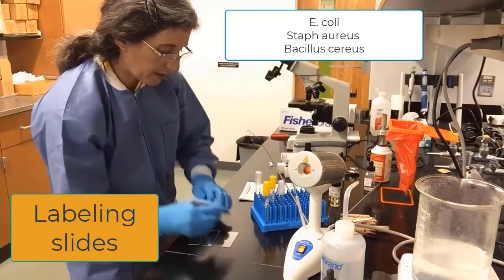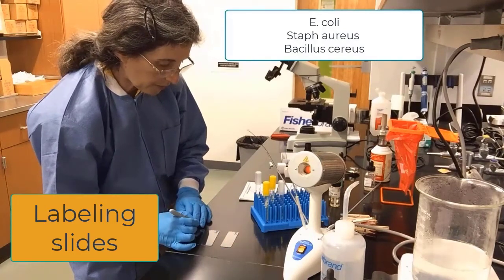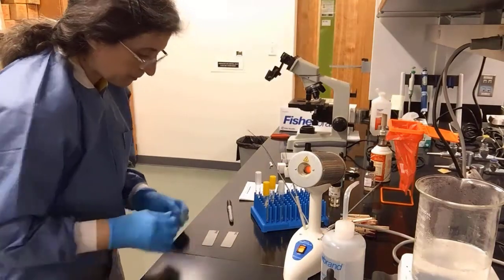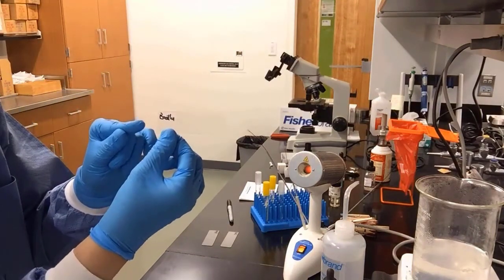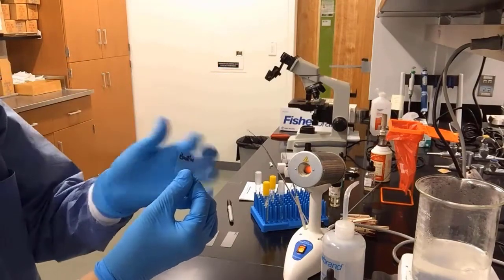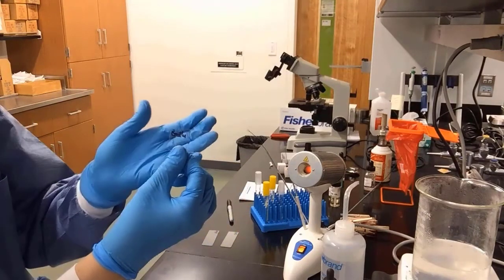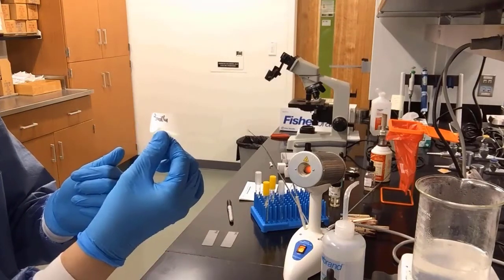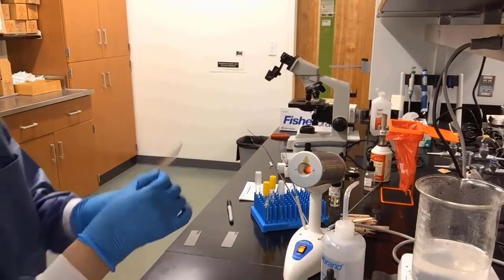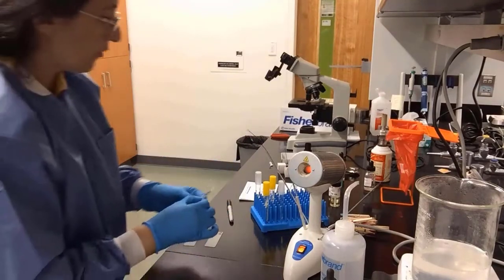Labeling our slides. The first thing we'll do is we'll label 3 slides, 1 E. coli, 1 Staph aureus, and 1 Bacillus cereus. Let's look at our slides. We have labeled bacillus on the far left side. We don't want to label in the middle because the ink will interfere not only with our staining procedure, but also with your microscopic view. So there's our bacillus slide labeled. Here's our staph slide, again labeled to the left side. And here's our E. coli slide.